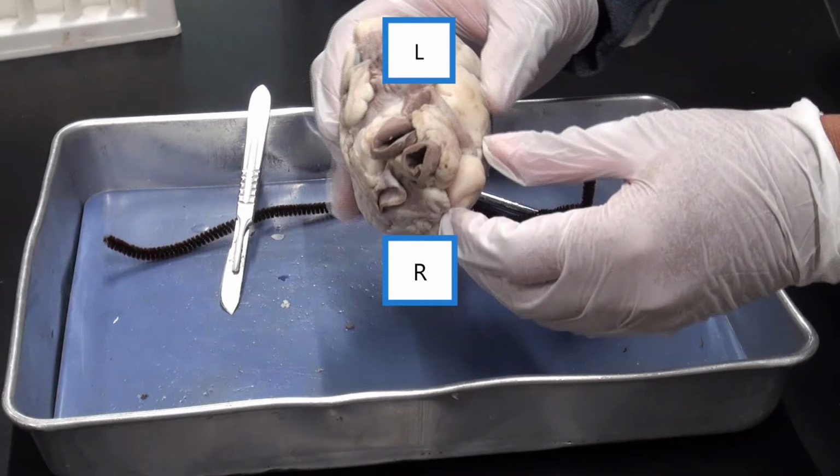Okay, so blood enters the heart through a number of different veins like brachiocephalic veins and superior vena cava, and they're going to feed into the atrium. Here's a picture I have of some of those blood vessels where they meet the heart, and I also have L and R labels to denote the left and right sides of the heart.